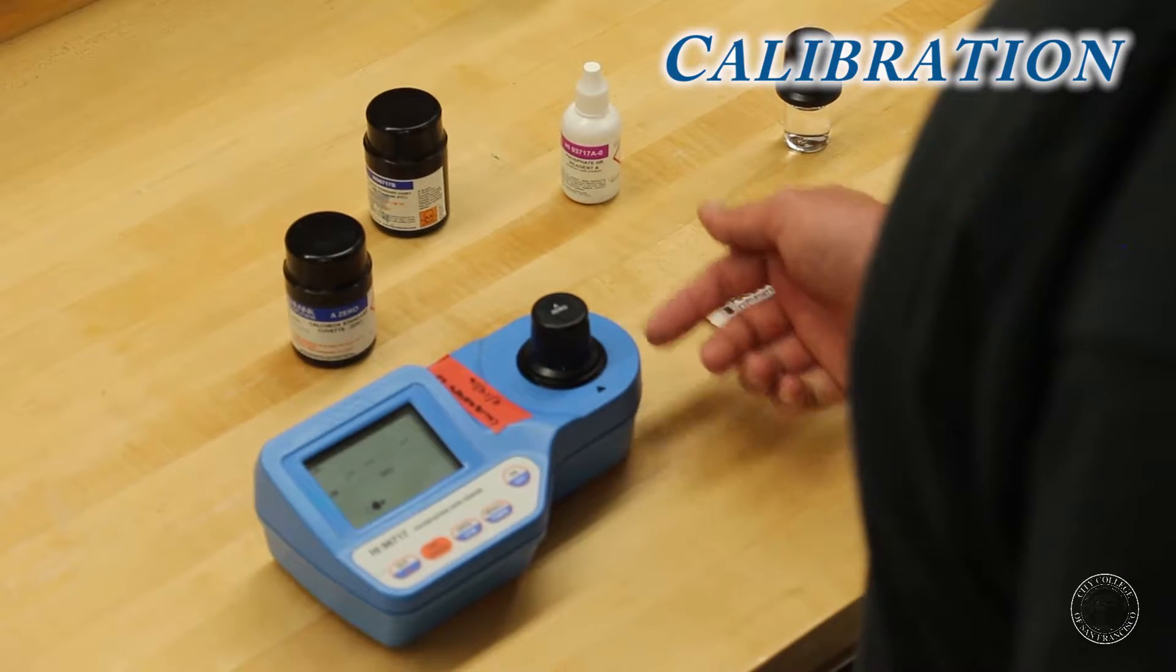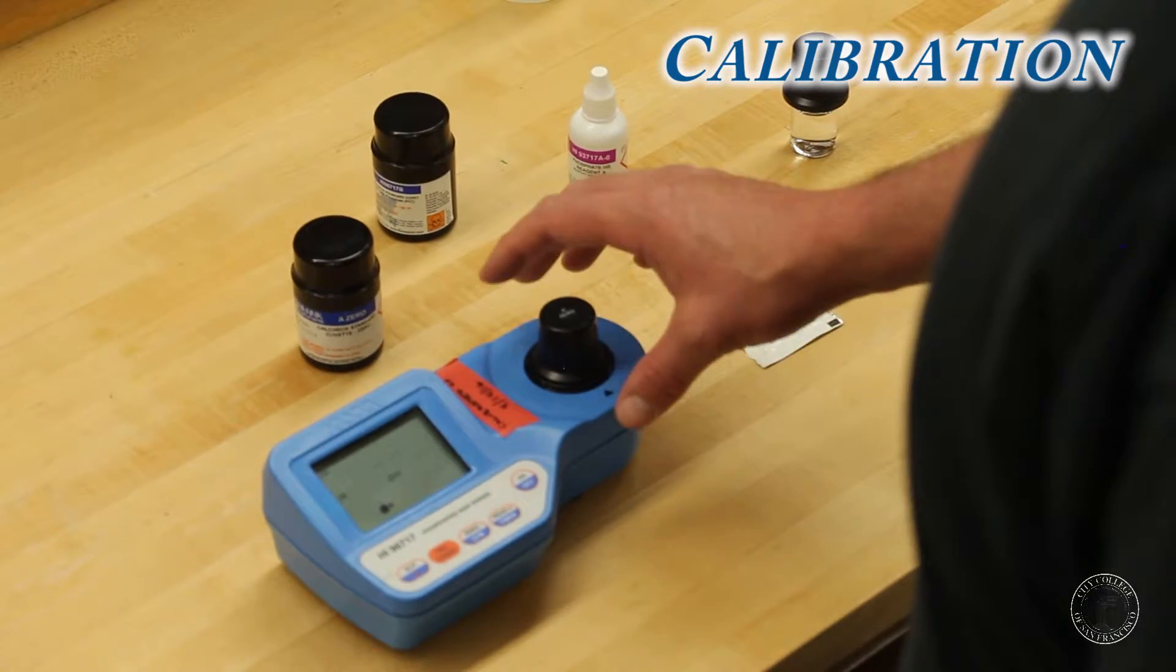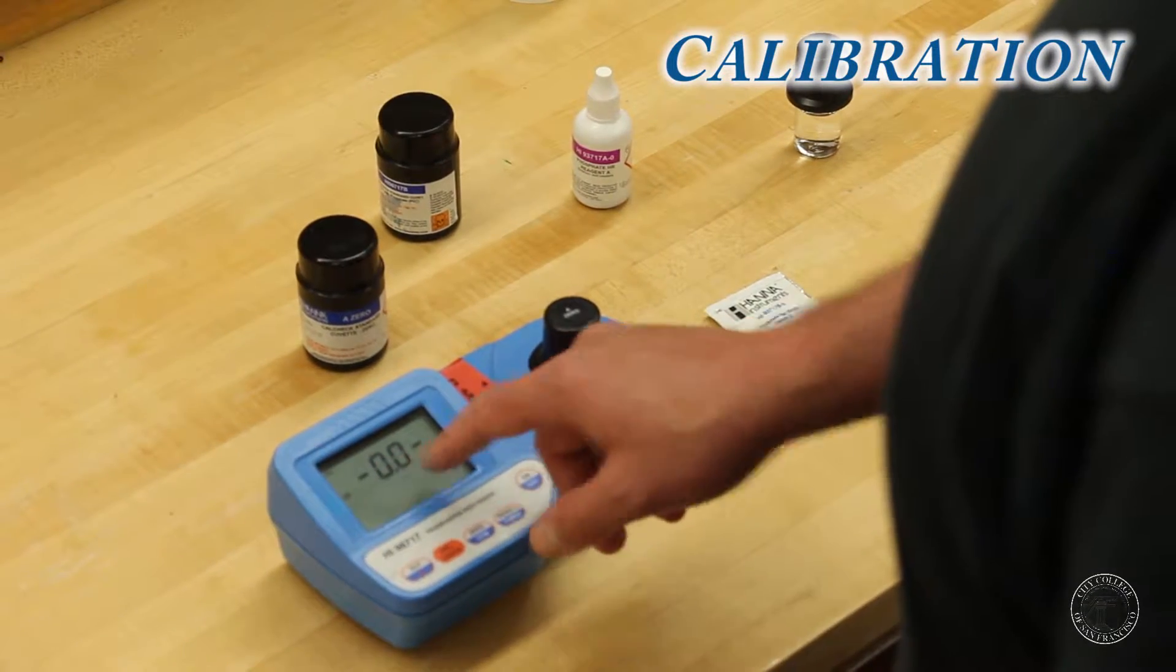Now the lamp in the machine is reading to see that this will be set as a zero, as it says zero.